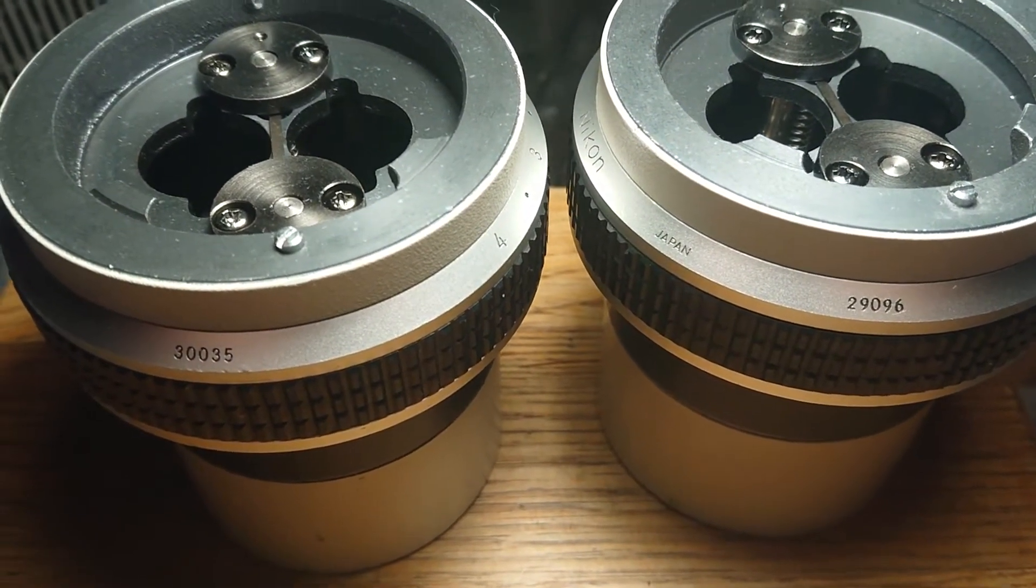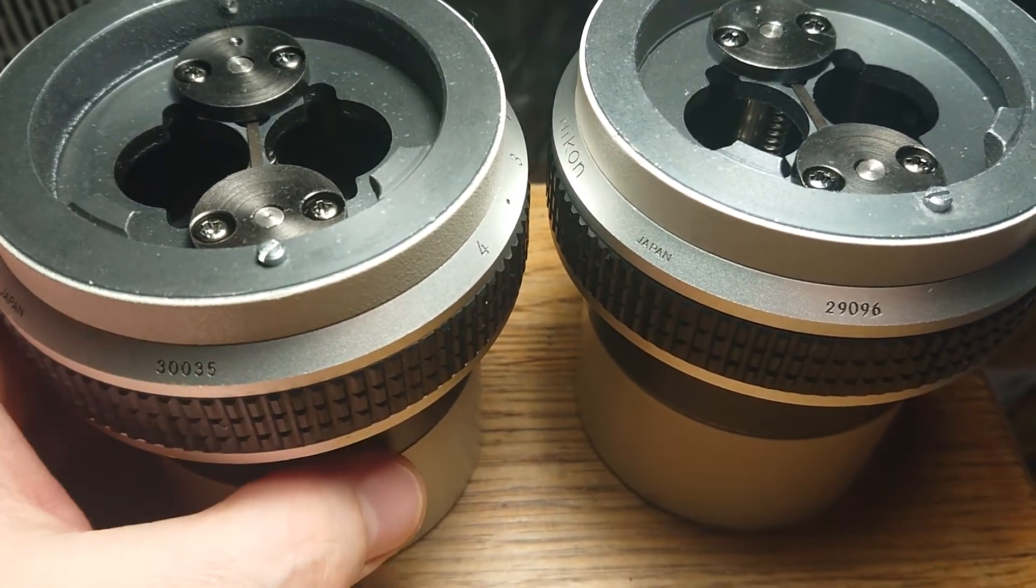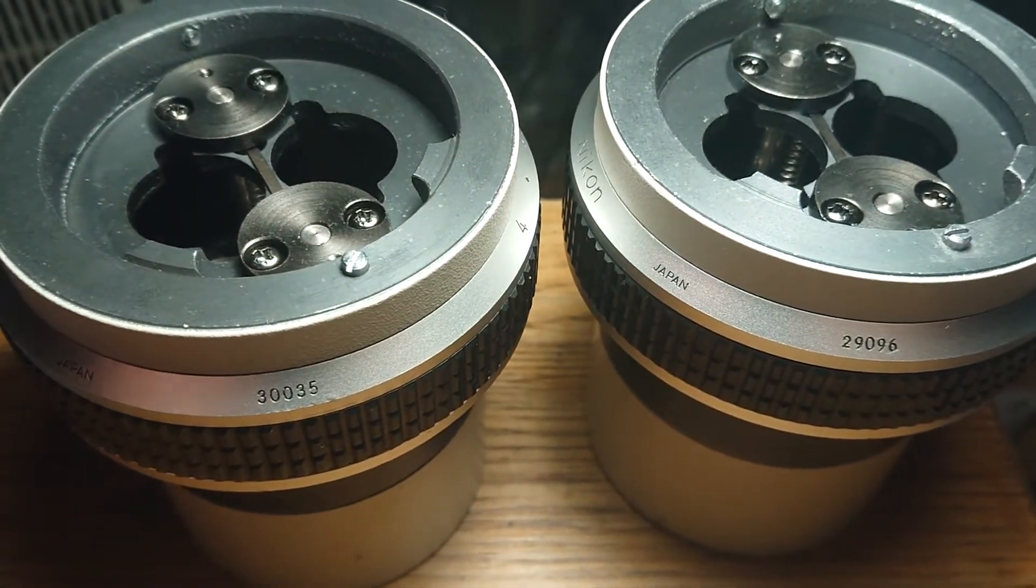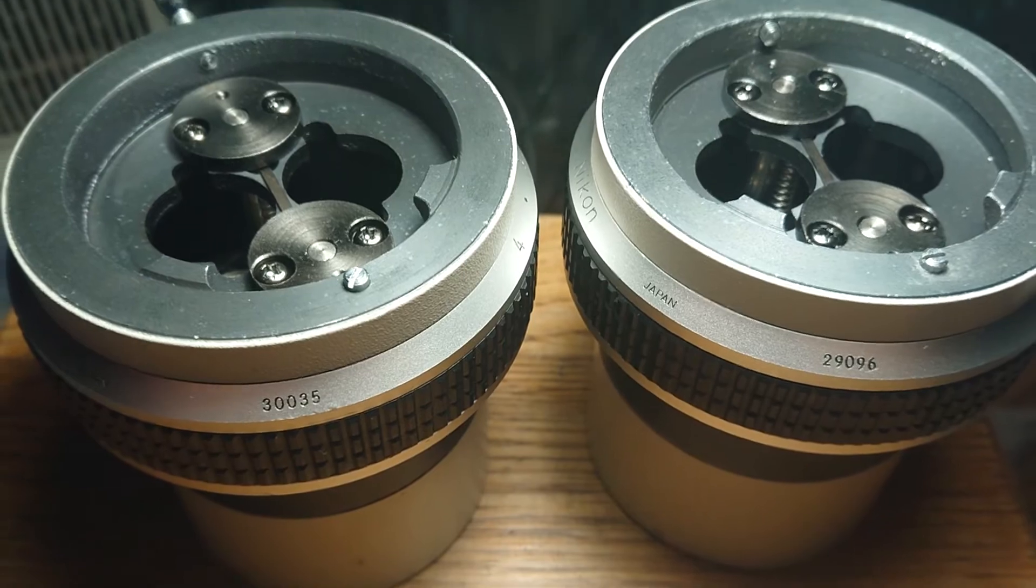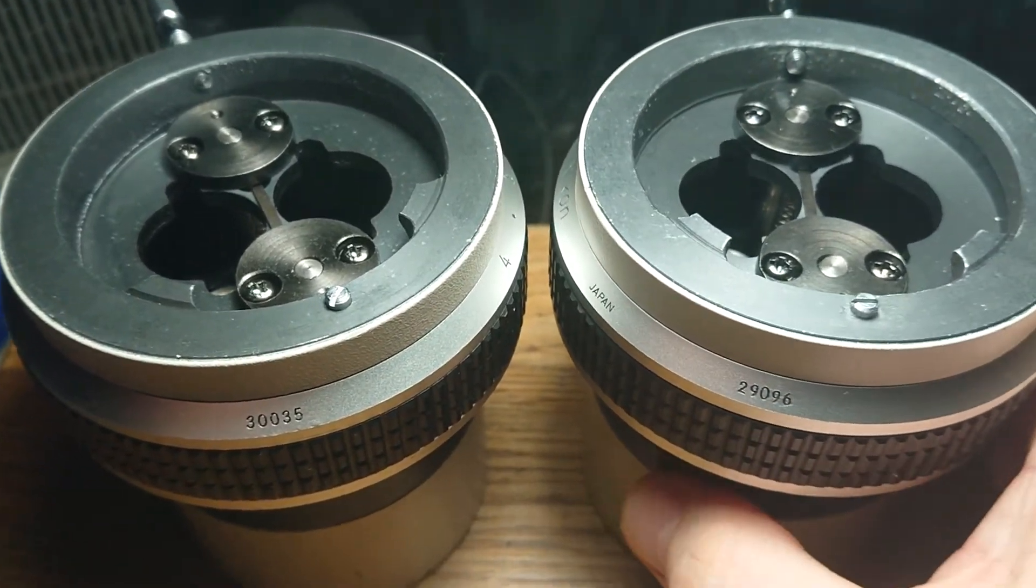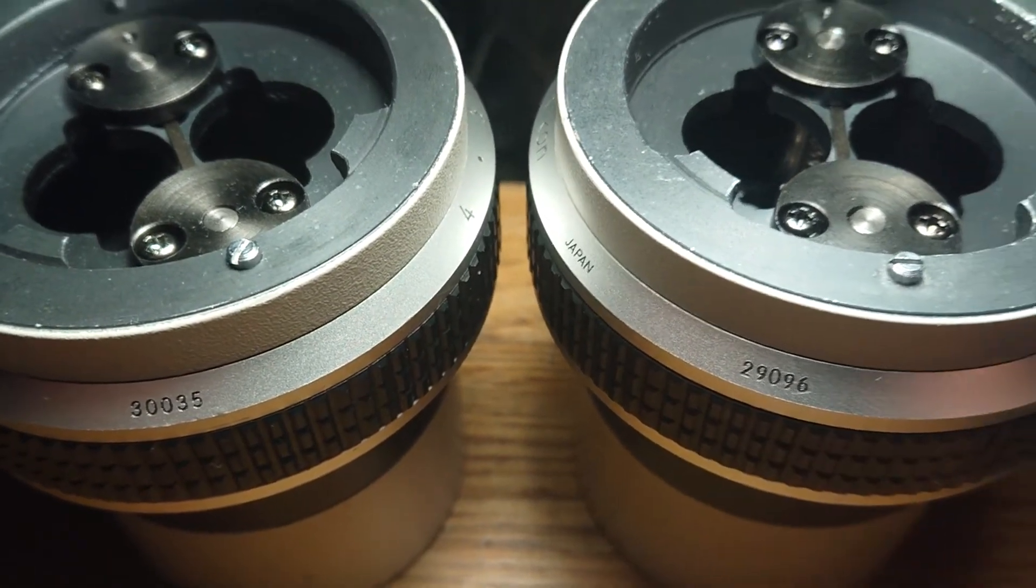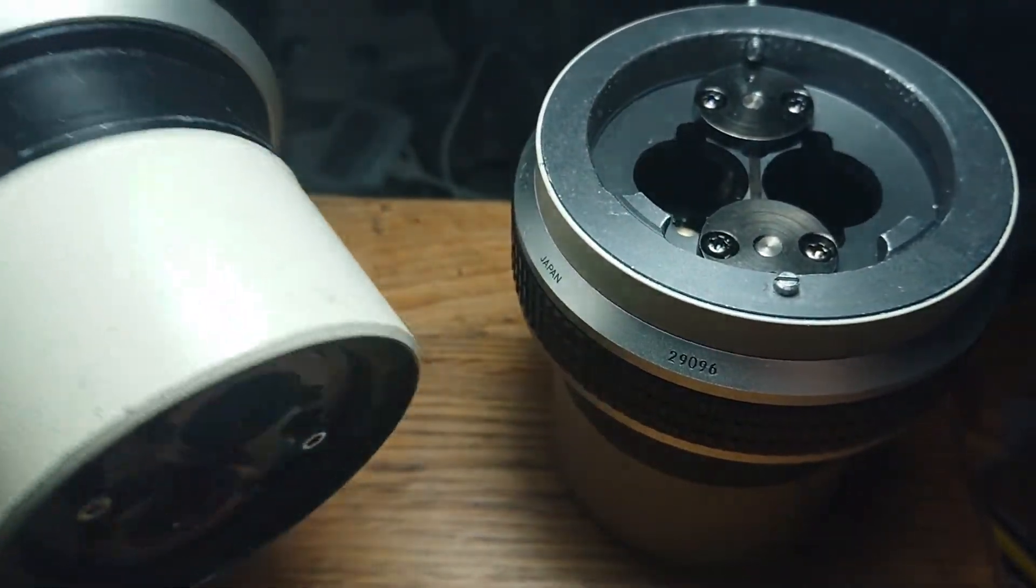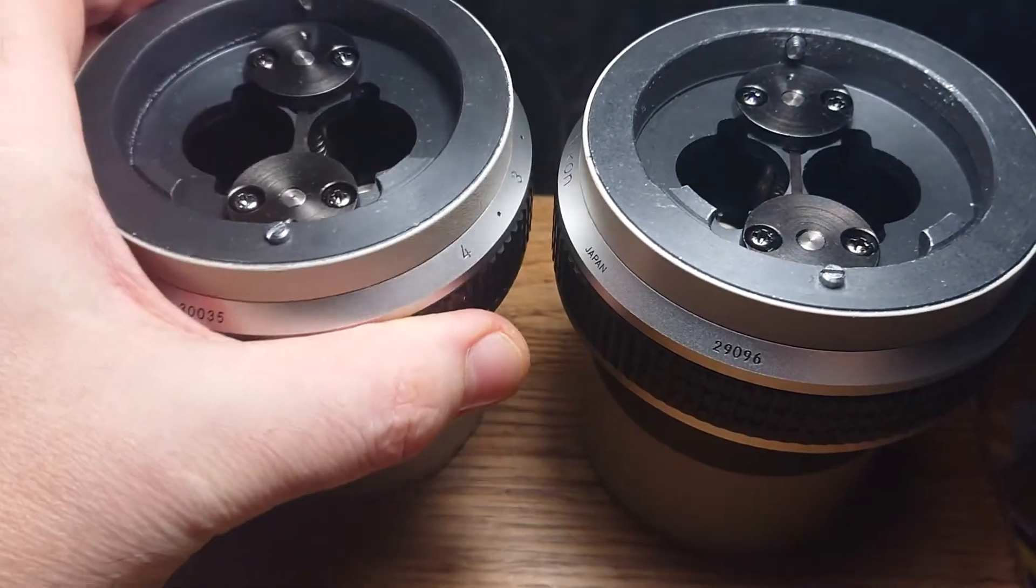So I have finally made maintenance for those two zoom bodies, and in a day they will move to the new masters.